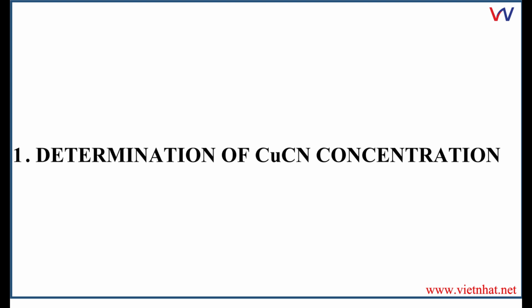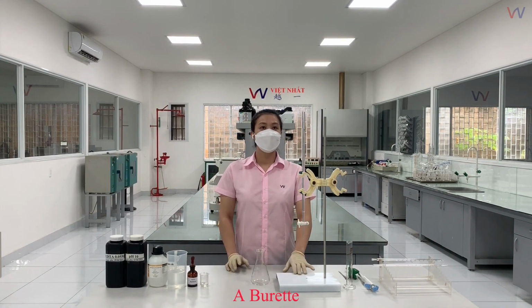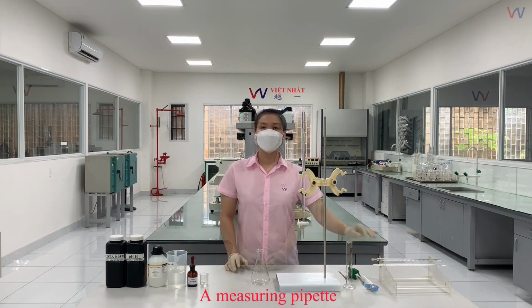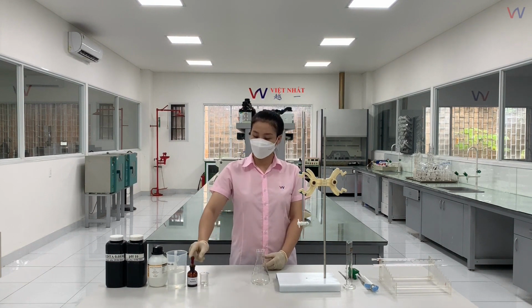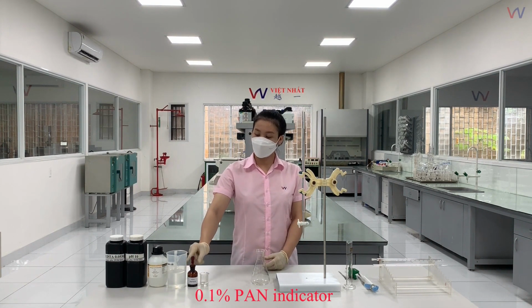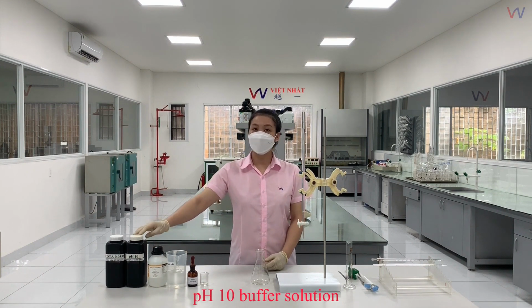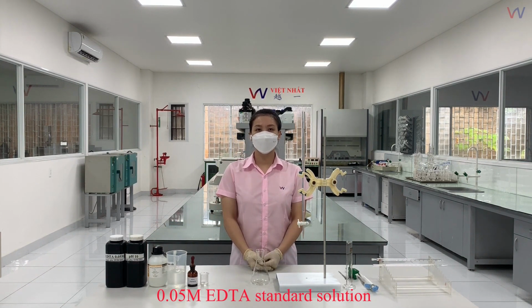The necessary equipment for the analysis includes an Erlenmeyer flask, a burette, a graduated cylinder, a micropipette, and a measuring pipette. It's advisable to use separate pipettes for each type of chemical to avoid inaccuracies and chemical contamination. For the chemicals, the following preparations are needed: the sample solution for analysis, PAN indicator 0.1%, distilled water, hydrogen peroxide 30%, pH 10 buffer solution, and ethylenediaminetetraacetic acid standard solution 0.05 M.